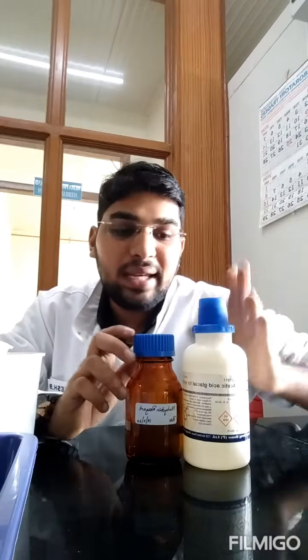In my case, I'm going to add 200 microliter of ninhydrin reagent, 200 microliter of acetic acid, and 100 or 200 microliter of the plant extract after centrifugation. All this I'm going to take in the Eppendorf tube, and place it in the boiling water bath for 1 hour. A nice bright reddish color will be formed after 1 hour. That indicates the presence of proline.